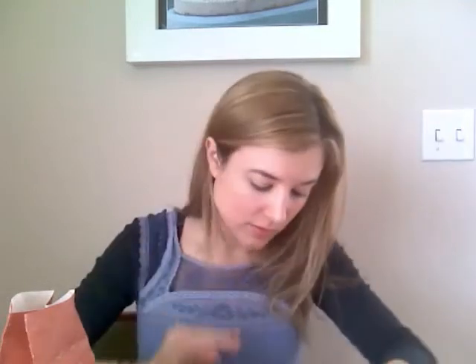I'm just going to be really gentle as I take my sample here and place it in the extraction solution. I'm going to replace the cap and shake this for 2 minutes. I've now placed 10 drops into my test tube, and I'm going to put my Easy Gluten Test Strip in there, arrows down, and allow that to sit for 10 minutes in order to develop.